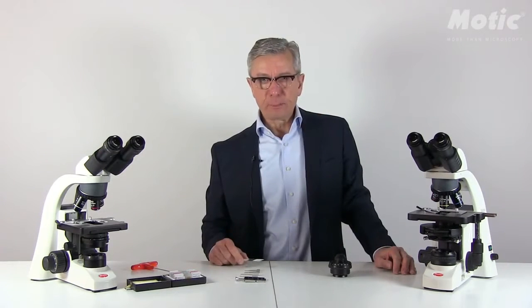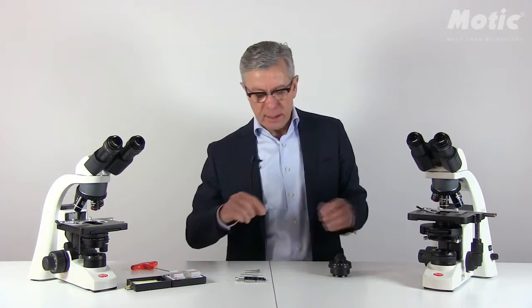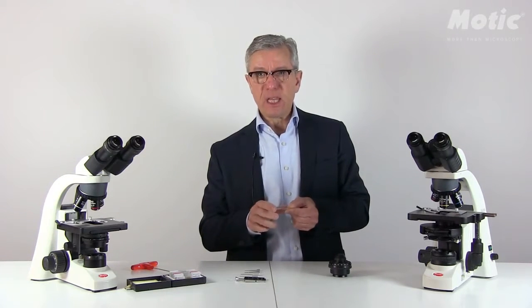Please note that the darkfield procedure is extremely sensitive to dust, fingerprints and any other kind of dirt on your sample. So please be careful that you have really a clean sample so that you do not destroy the aesthetic impression of the darkfield.